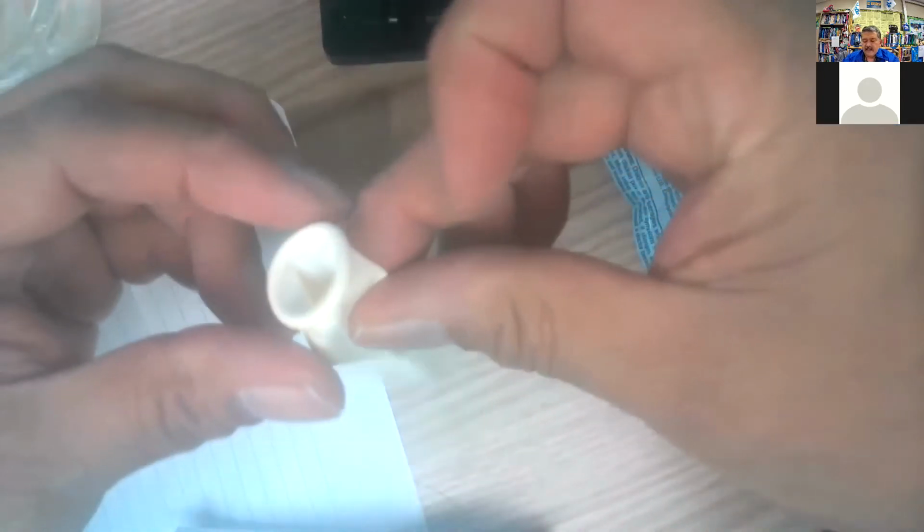In it, 2 different places. Got that thing started. Air's out. We're in tablet number 1. Open up the last envelope and get the rest of that in there. Okay, that's working pretty well. That's why I folded this.